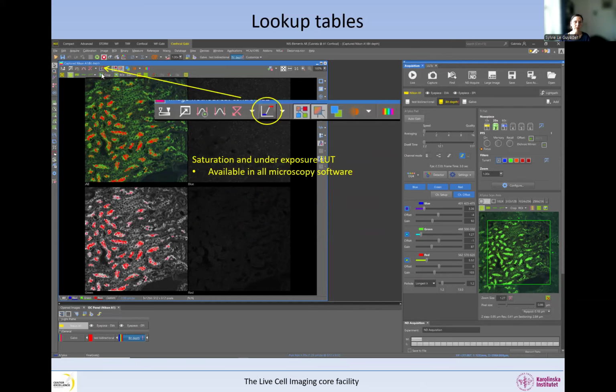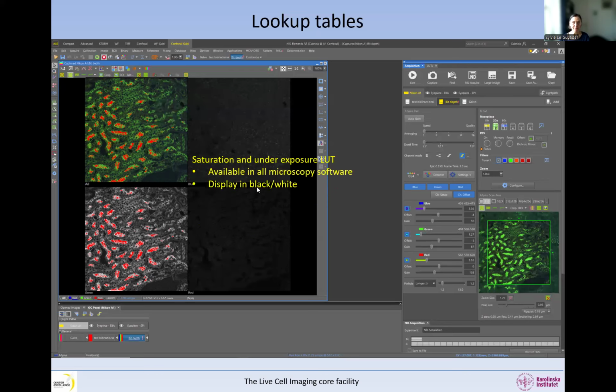So in the Nikon software, it's in here, and you will need to tell me where to find this in your software. So you'll need to do a screenshot like this where you can show me. And this is what it looks like. And so what it does is that it displays the colors in black and white, if ever you didn't have them in black and white. And then it adds this color mask where the saturated pixels, the ones that are the highest intensity level of the bit depth, are color-coded often in red, but it's not always the case. And those that have an intensity 0, they are underexposed and they're color-coded in blue.